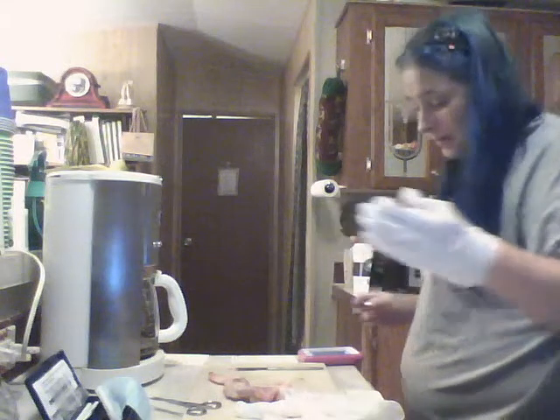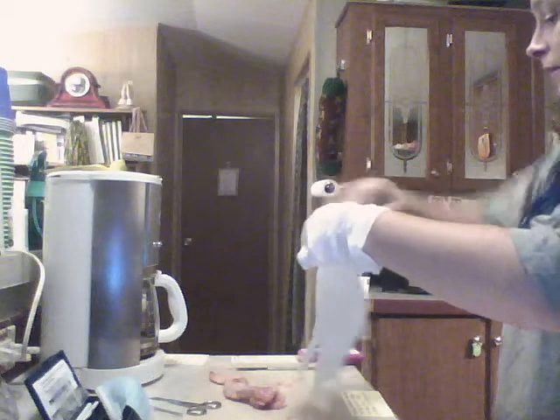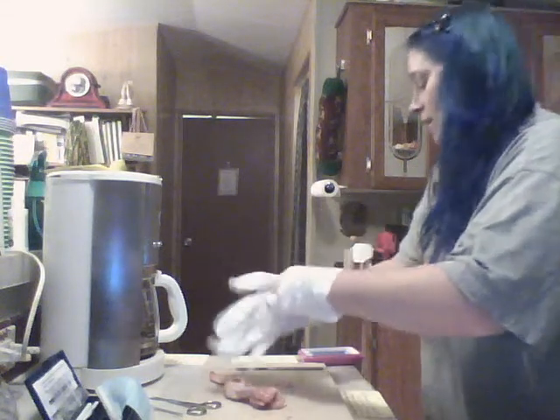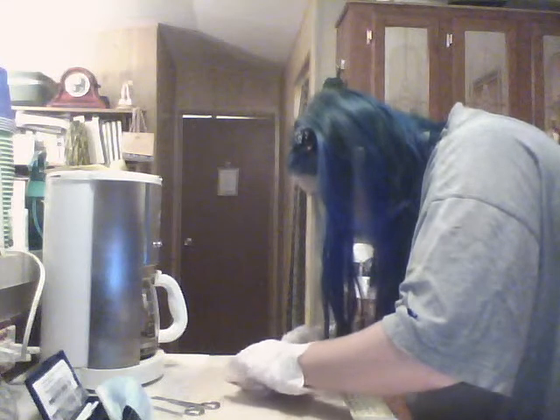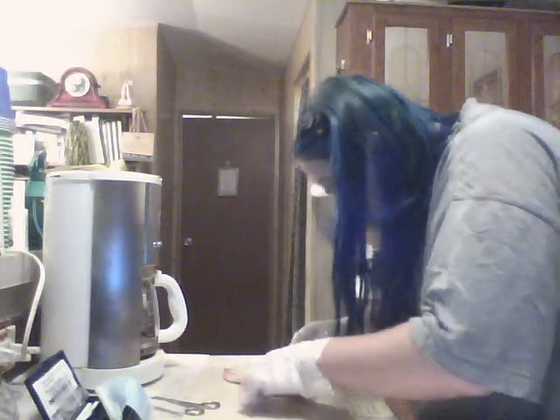Next, feel different. That cut pretty easy.